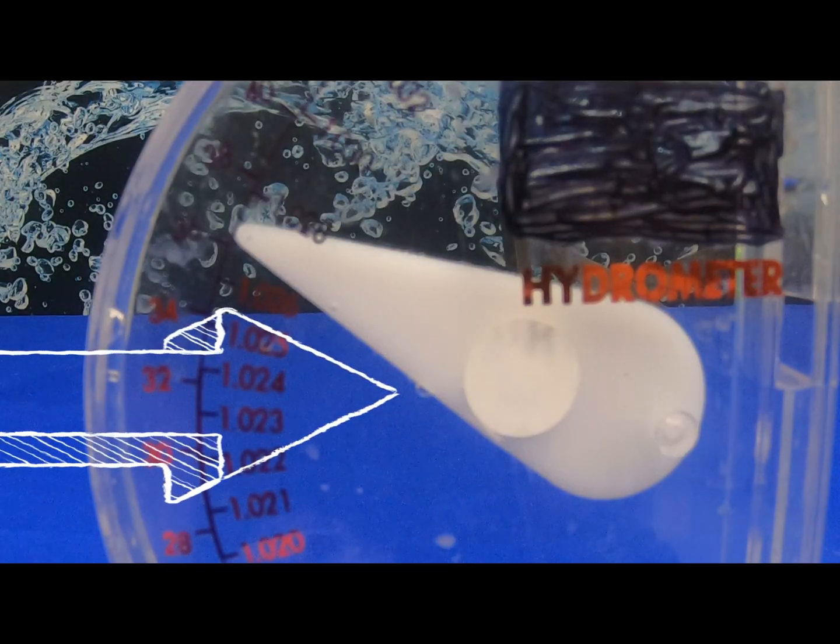When using a hydrometer, you must completely fill the hydrometer in order to read samples. In doing so, it can possibly create air bubbles on the hydrometer needle, which will give you inaccurate readings.